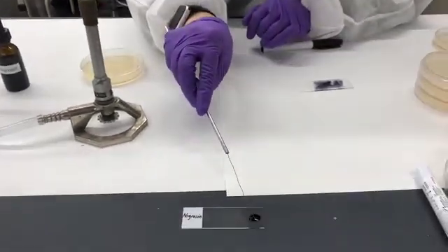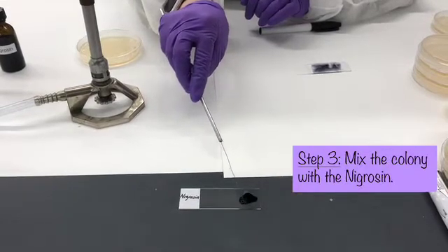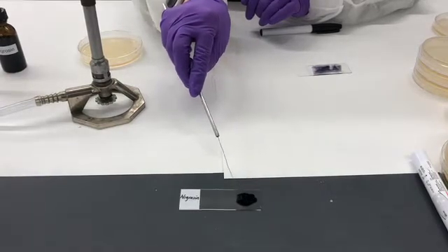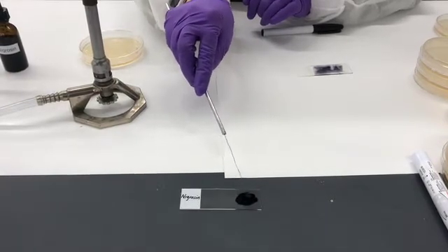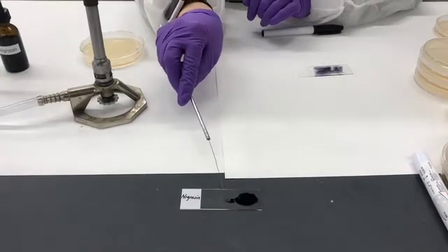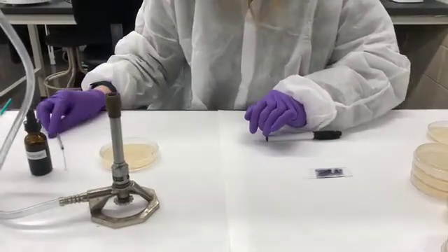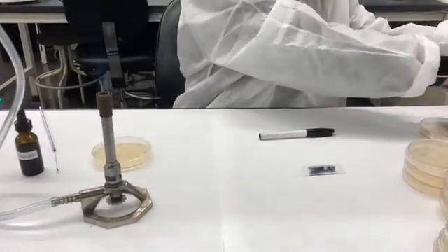We will mix that colony with the nigrosine in order to get a nice release of the bacterial cells into the suspension of this dye. Our last step is to spread the dye across the surface.